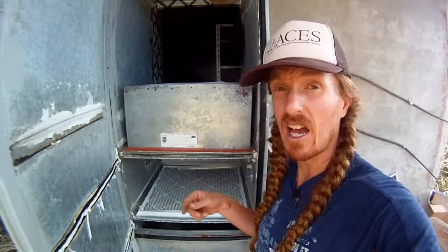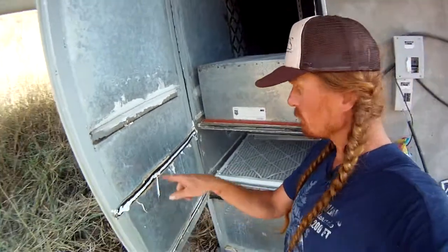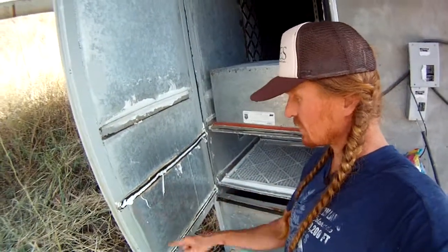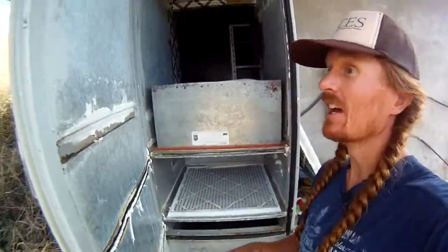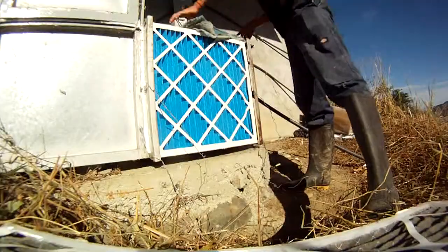It'll protect this big guy. And I dropped a little bead of silicone on these things. I seal all the edges with silicone so nothing can get around the outside. And now I'm ready to shut the door. That's right. Close it back up. After I get this sealed back up, I'm gonna get these pre-filters back on, and then it's ready to go, except I want that silicone to dry. So I'm gonna let that silicone dry at least overnight.